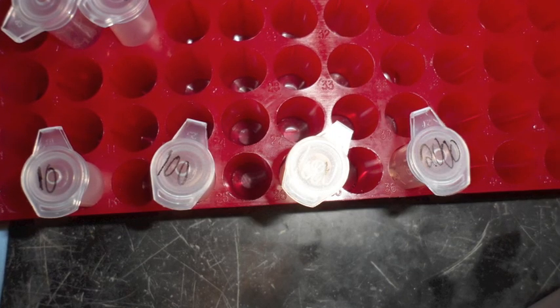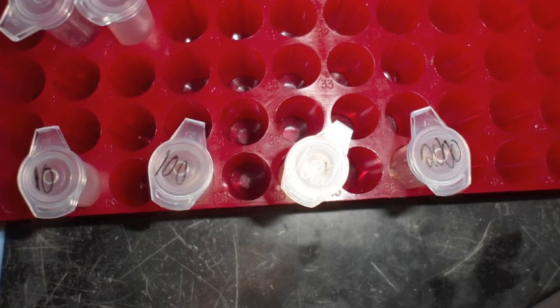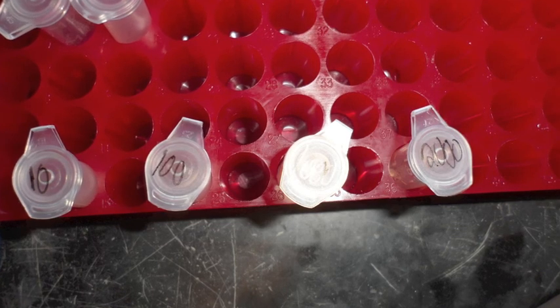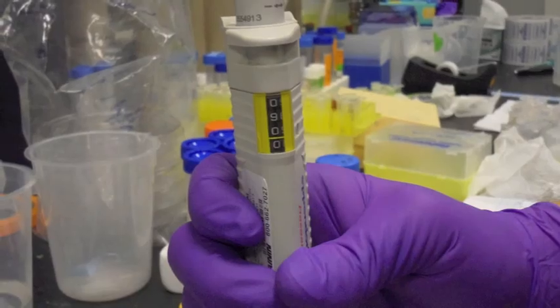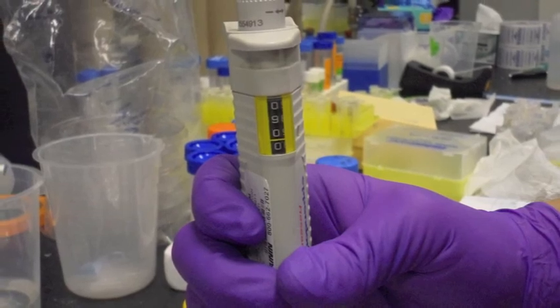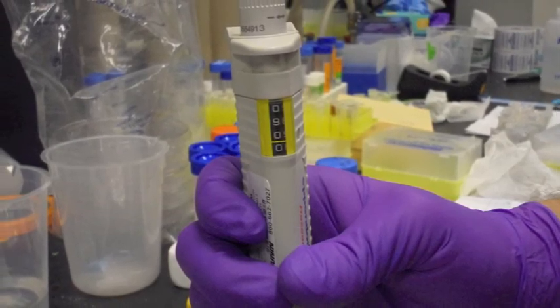In this procedure, we will be using concentrations of 10 nanomolar, 100 nanomolar, 1,000 nanomolar, and 2,000 nanomolar. The volume of each sample should be 100 microliters. Make sure that you make the solution accordingly.